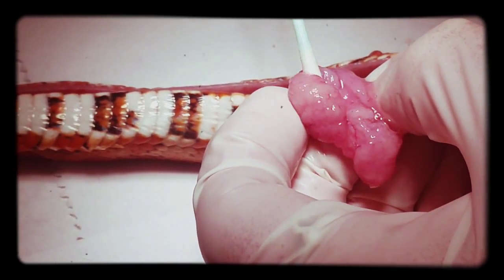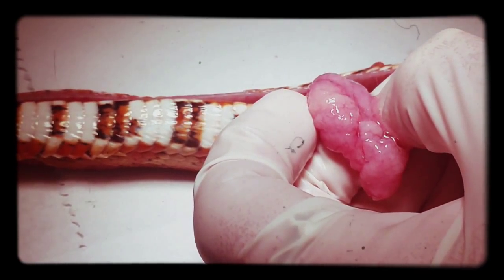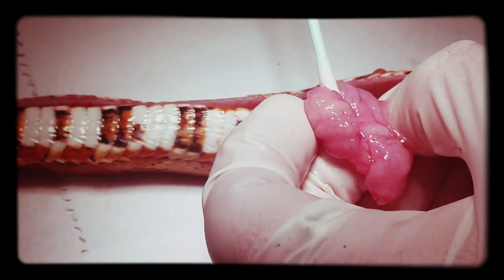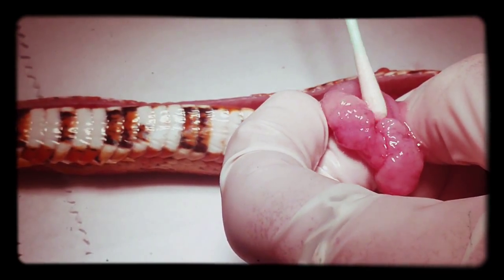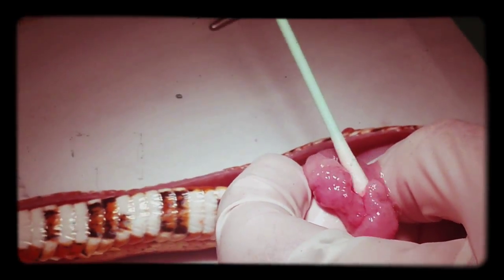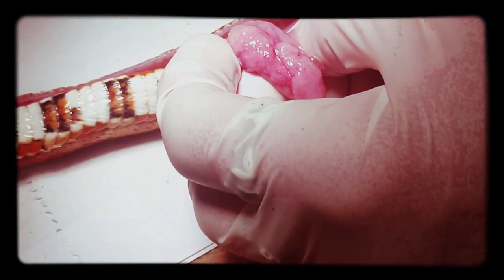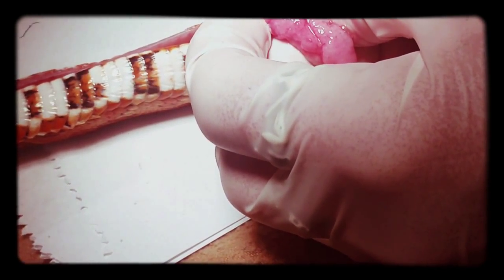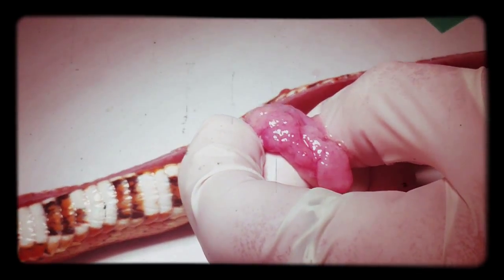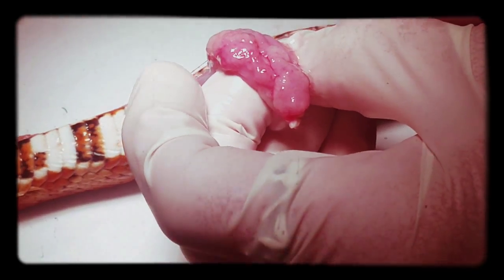And the formaldehyde in this tube? No. We've got the jar for the formaldehyde. No, those are going to be frozen in case they just want tissue to have ground up and do something with. It's loose, but it's not shut. It's not now. It's crazy on there. So yeah, we just need to break that off. Cut it off and then close it. And that's open.